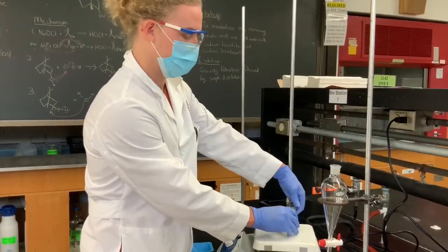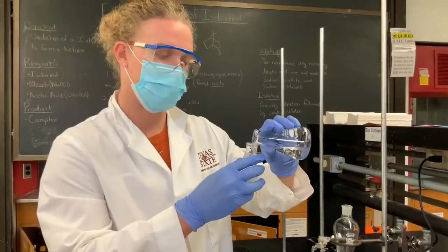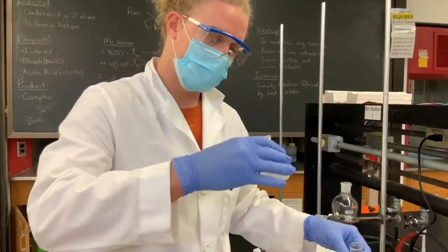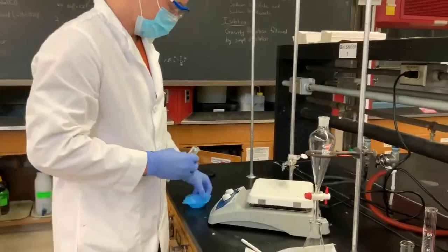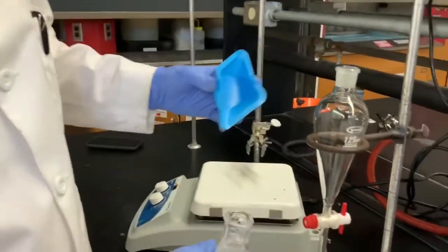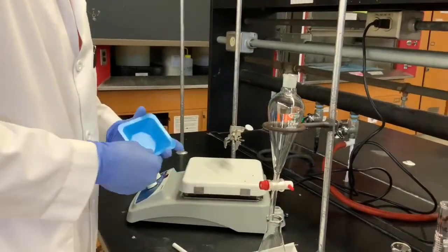First, what we're going to do is add half of the water to get everything into aqueous solution, and then transfer it into the separatory funnel. Anything remaining after this first transfer, we're going to add the second half of water to help get everything else into solution. Make sure the separatory funnel stopcock is closed before adding — otherwise all the solution will come down.